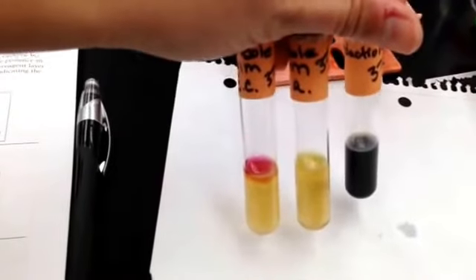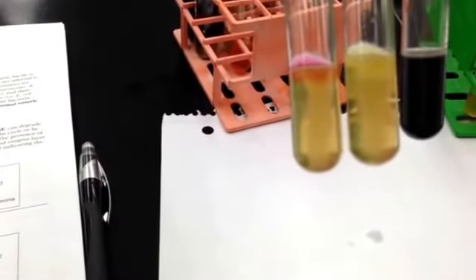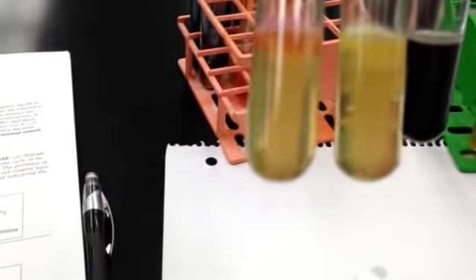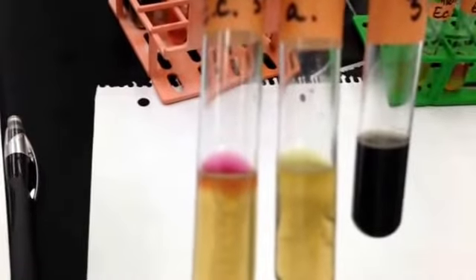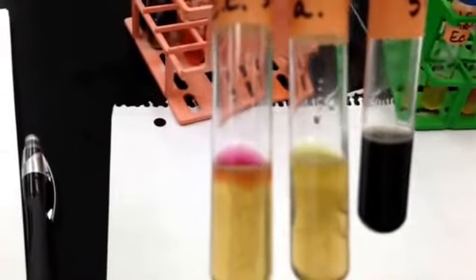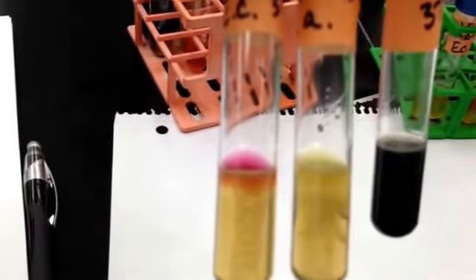And we look at, this is also testing for motility. So you'll see that both Enterobacter aerogenes and Escherichia coli were motile because they're nice and squirmy in terms of where they went from the stab. So this tests for sulfur, tryptophanase, and motility.